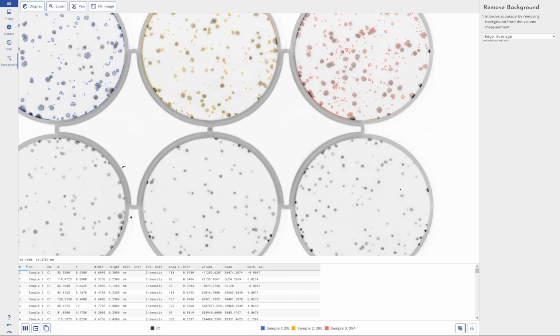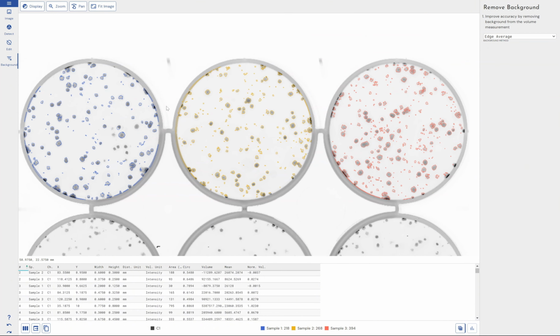And of course, we can offer this software in a 21 CFR and GMP compliant solution, as well as supporting Linux, Mac, and Windows operating systems. So that's a quick drive-by demo of how you would go through performing an ELISpot analysis within the Phoretix Colony Counter software. I've not gone into a huge amount of depth here. I wanted to keep the video quite short and accessible.